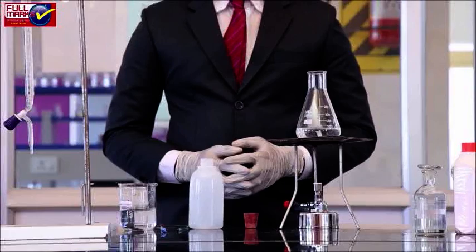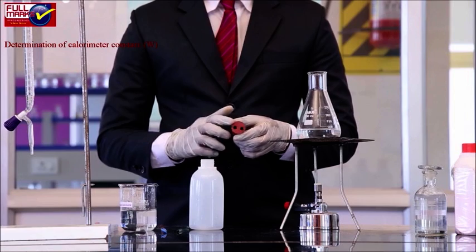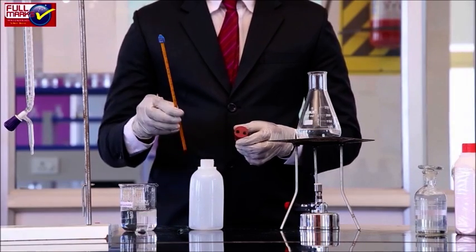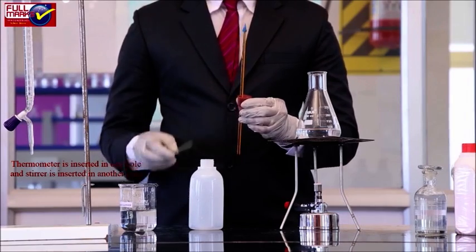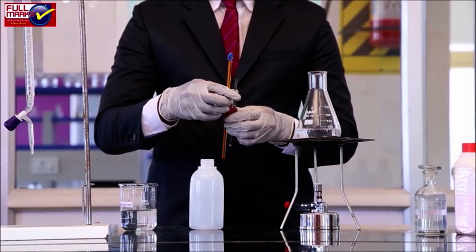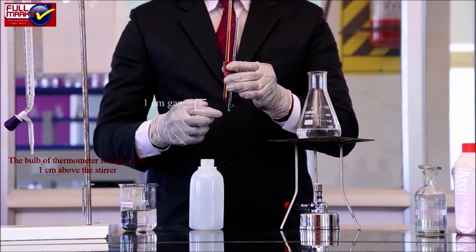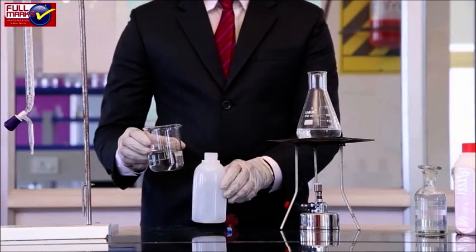Procedure: Determination of Calorimeter Constant (W) of the calorimeter polythene bottle. The rubber cork with two holes is fitted in a clean polythene bottle. The thermometer is inserted in one hole and the stirrer is inserted in another hole. The bulb of the thermometer is kept about 1 cm above the stirrer. 100 ml of distilled water is put in the bottle.